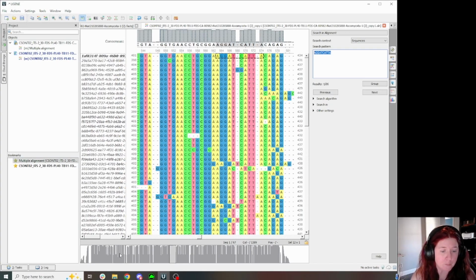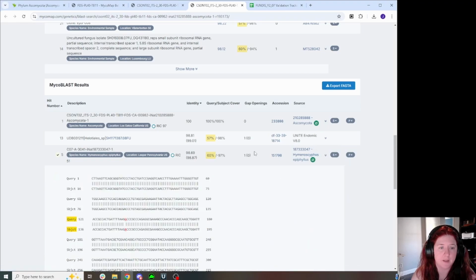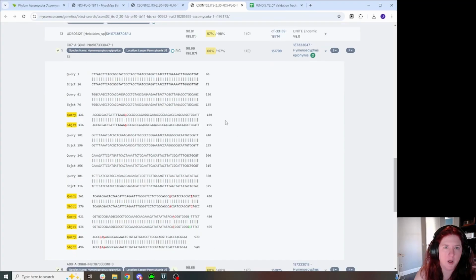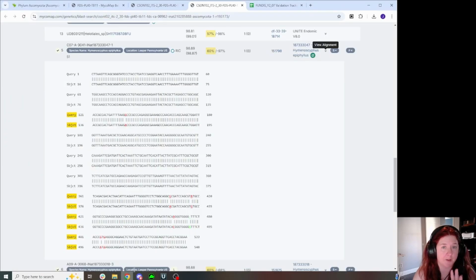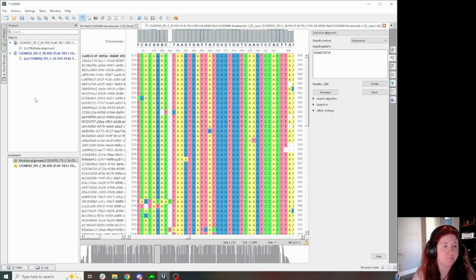group 1 intron. So then, knowing that, I can go back in and evaluate these sequences with the knowledge that what I'm looking at has a little bit of weirdness going on. There's two ways I could resolve this. I could cut out this group 1 intron and just BLAST it without the intron to make sure my query cover is good. Or what I could do, and I think it's what I'm going to do in this case, is I'm just going to put it into UGENE manually.